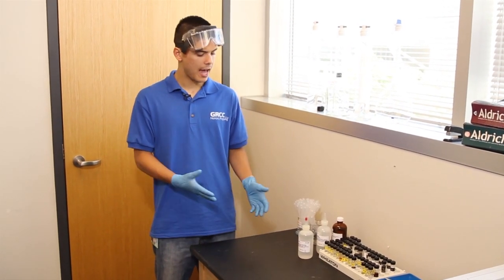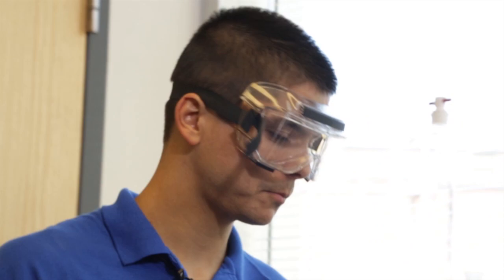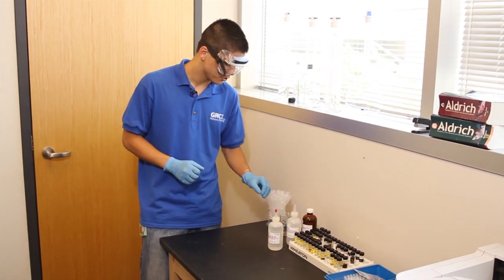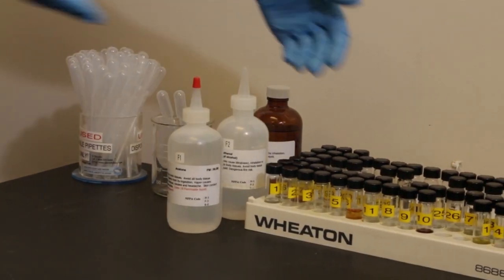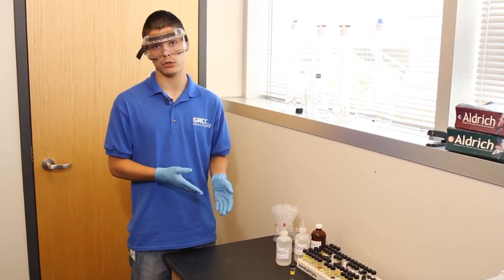The first thing I will do is prepare my sample. As I am working with chemicals, I have gloves on to protect myself, and I will also put on my safety goggles. These are necessary whenever you're working with chemicals for your own protection. I have a couple of solvents here and my samples. I'm going to pick one of these samples, and the sample I picked is concentrated, so I will have to dilute it.